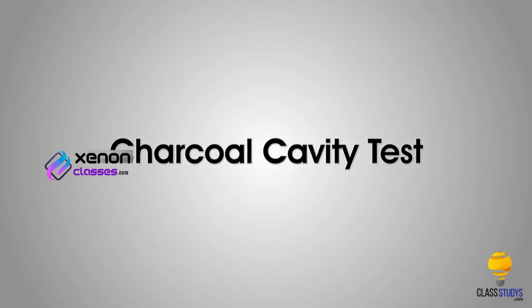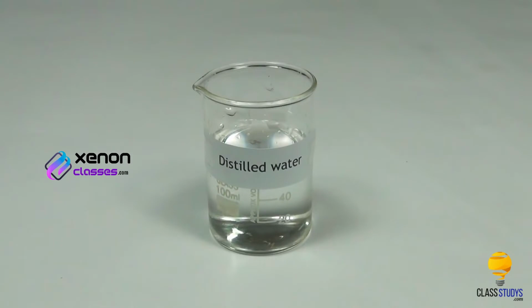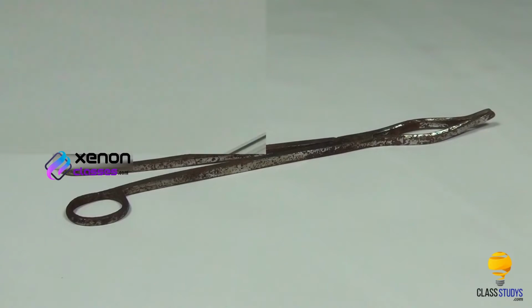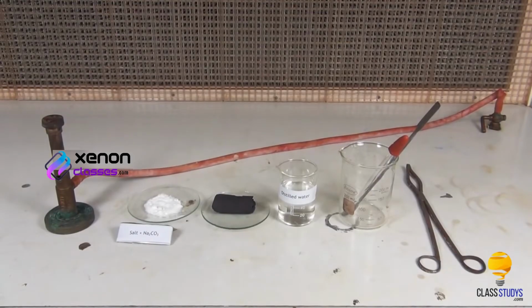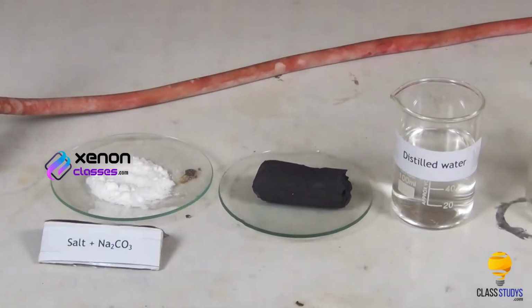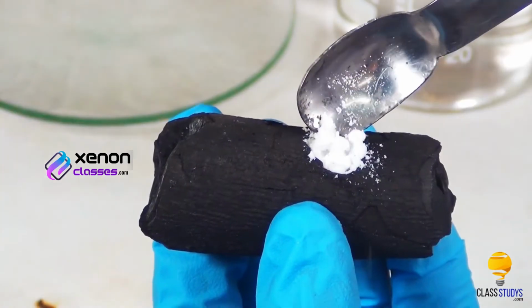Charcoal cavity test. Materials required: mixture of salt and sodium carbonate in a watch glass, charcoal piece, distilled water, spatula, dropper, tongs, blowpipe and Bunsen burner. Procedure: take a mixture of a small quantity of salt and double its quantity of sodium carbonate in a watch glass. Take a charcoal piece with small cavity in it. Using a spatula, place a small quantity of the mixture in the cavity of the charcoal piece.